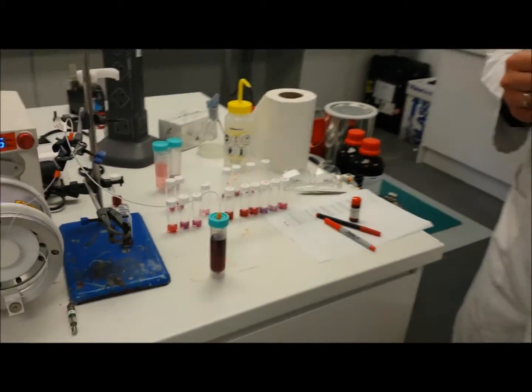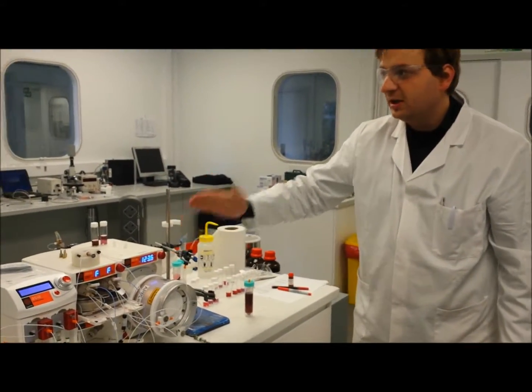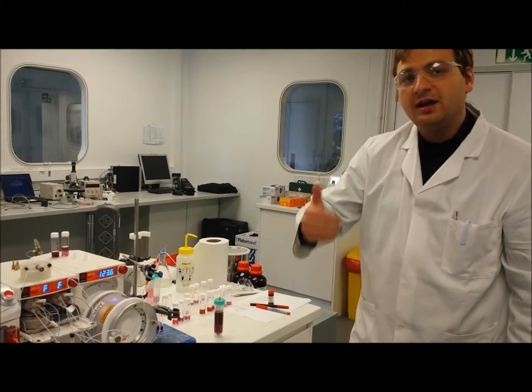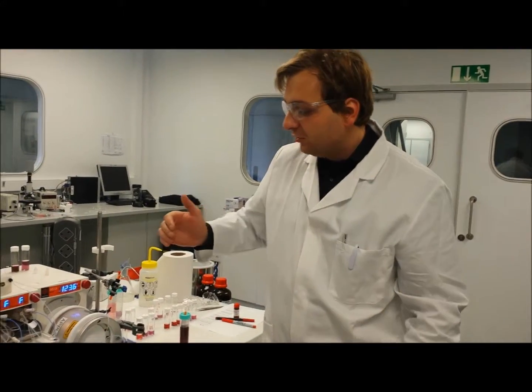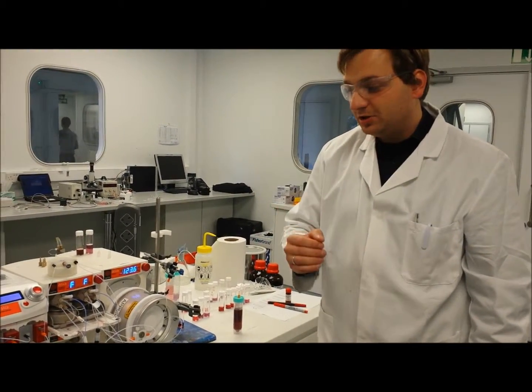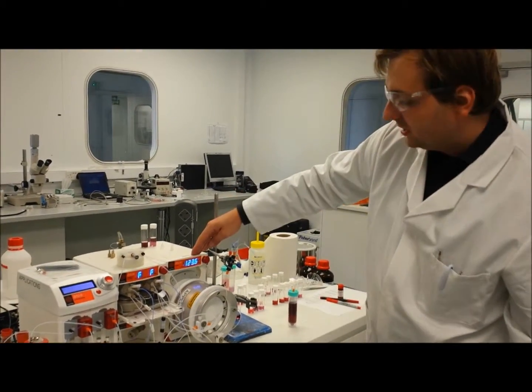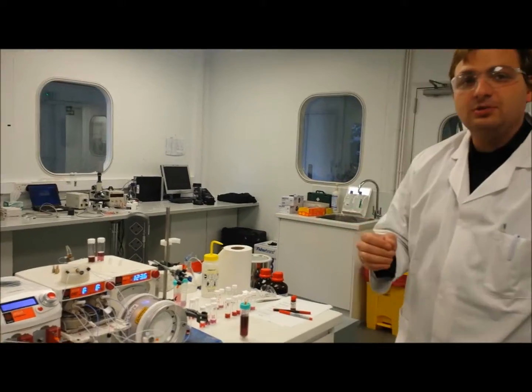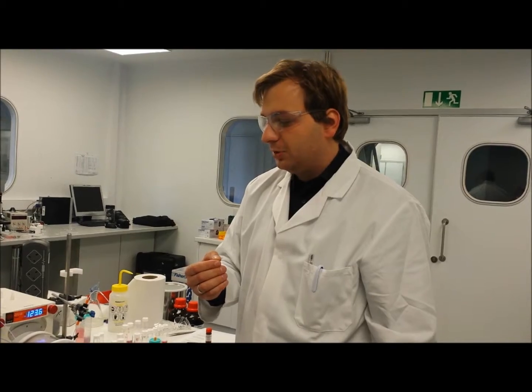And then another clever bit that flow chemistry enables us to do is it enables us to control the pressure on the back end. That means we can pressurize the entire system, and that means we can use temperatures that far exceed those available to the standard batch chemistry reactor. So for example, at the moment, we're using a reduction of gold salt in water at 123 degrees centigrade. And that enables us to nucleate our particles much quicker, and that enables us to produce those particles with unprecedented levels of monodispersity. And this is a quick overview of an Asia flow system and production of gold nanoparticles.